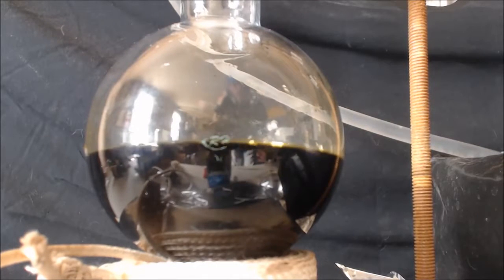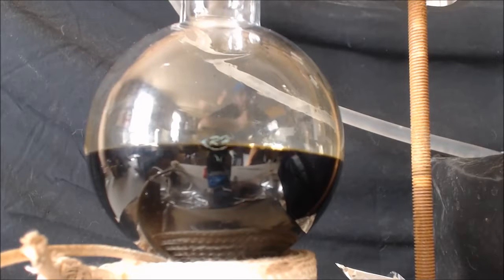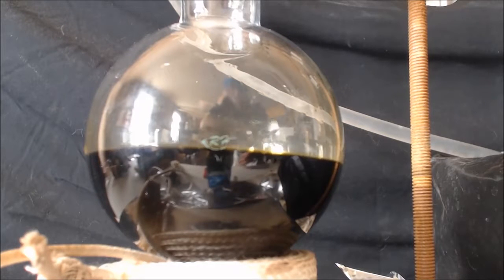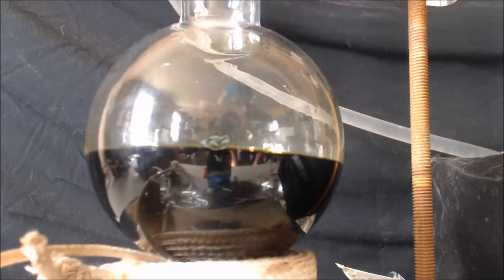Alright I'm going to put some more in. Oh that time I put a lot. There it goes. I'll cover the top up again, cap it. I didn't tighten it, it's just sitting on here.